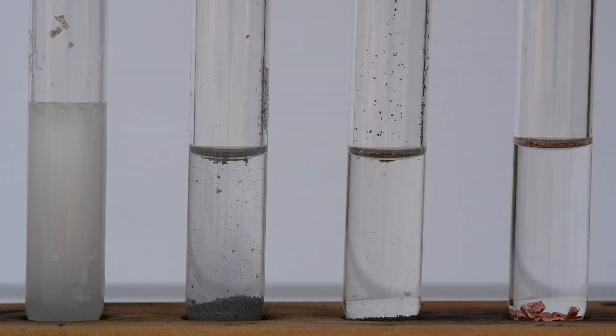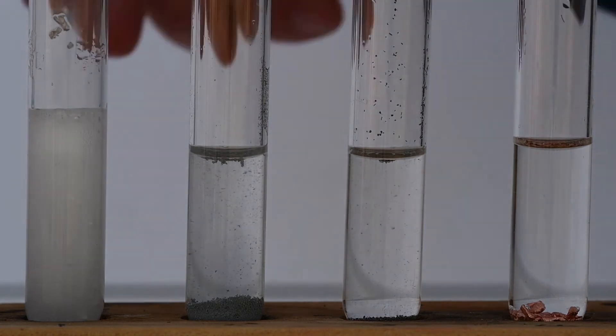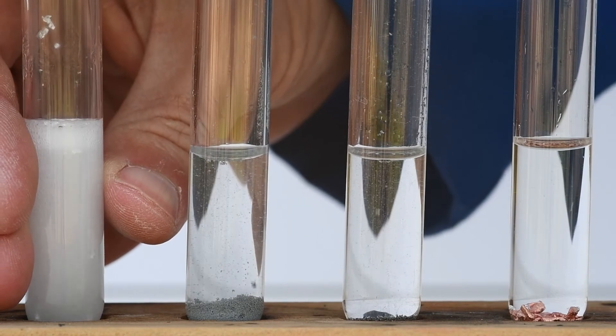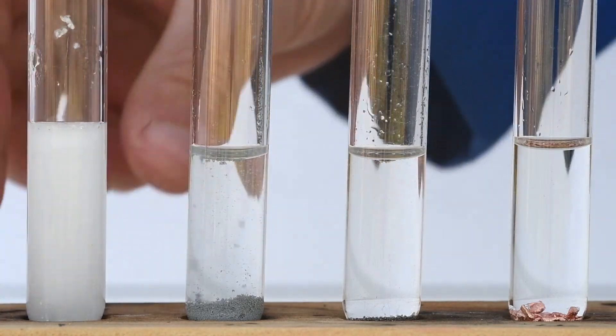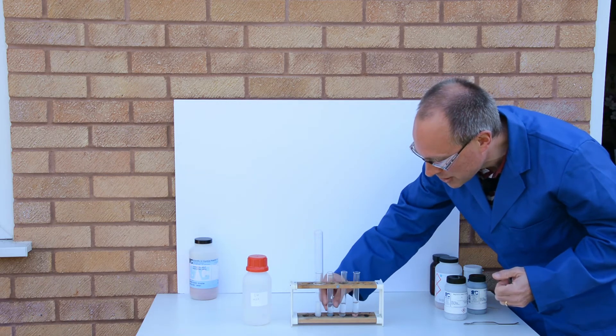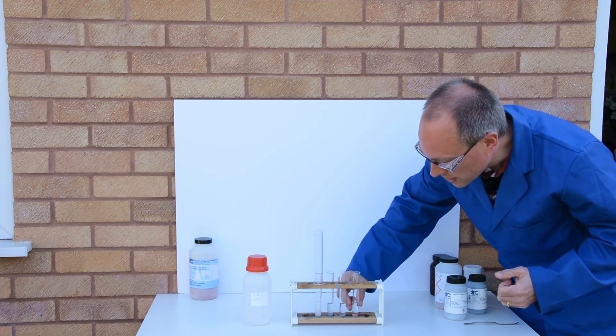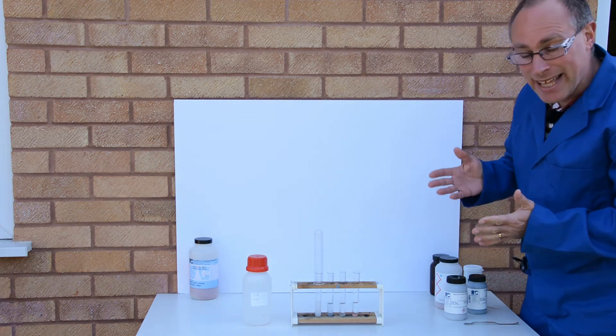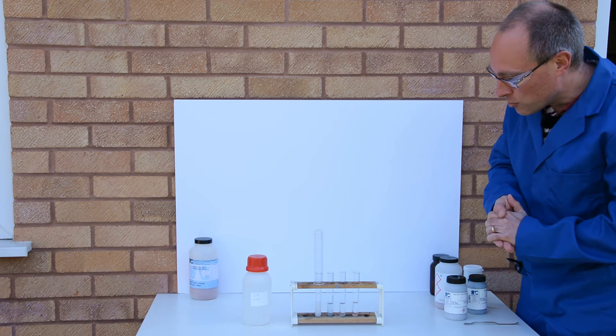We'll just leave those for a couple of minutes. What I would say is that the test tube with the magnesium in is also quite warm, showing us that the reaction is giving off some heat energy. These other ones don't feel that warm, but they will be slightly warmer.